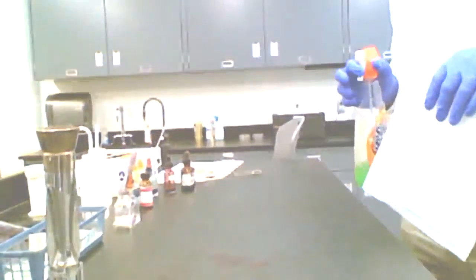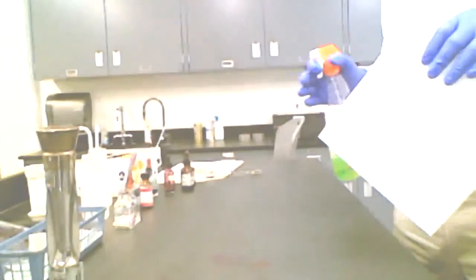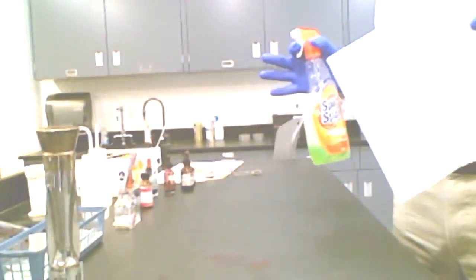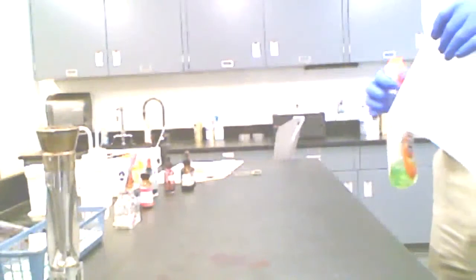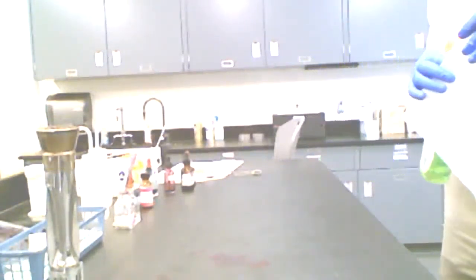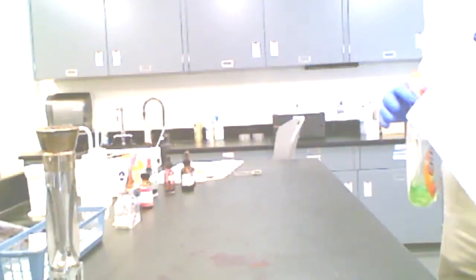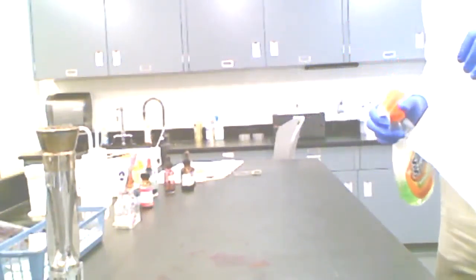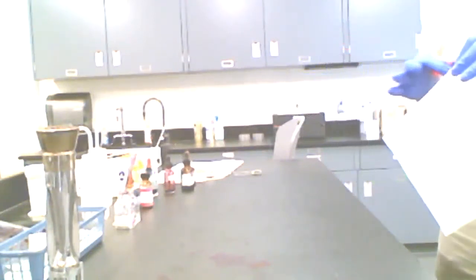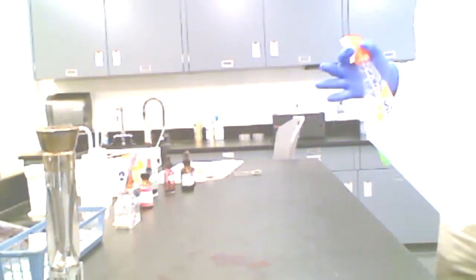And there it goes. All right, so the first thing is our workspace needs to be disinfected. There are likely going to be some bacteria, fungal spores, various things that are ubiquitous. They're everywhere, and we have to try to reduce the frequency of those in our environment. We need to cut them down so that we can prevent contamination. We're not going to get rid of them entirely. That's sterilization, and we'll be talking about that later. But the best we can do is disinfection.